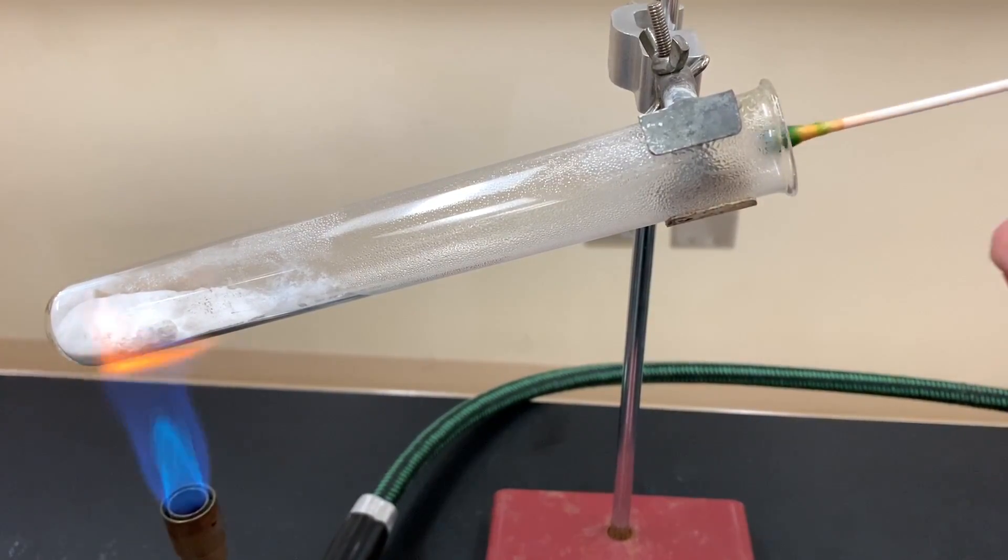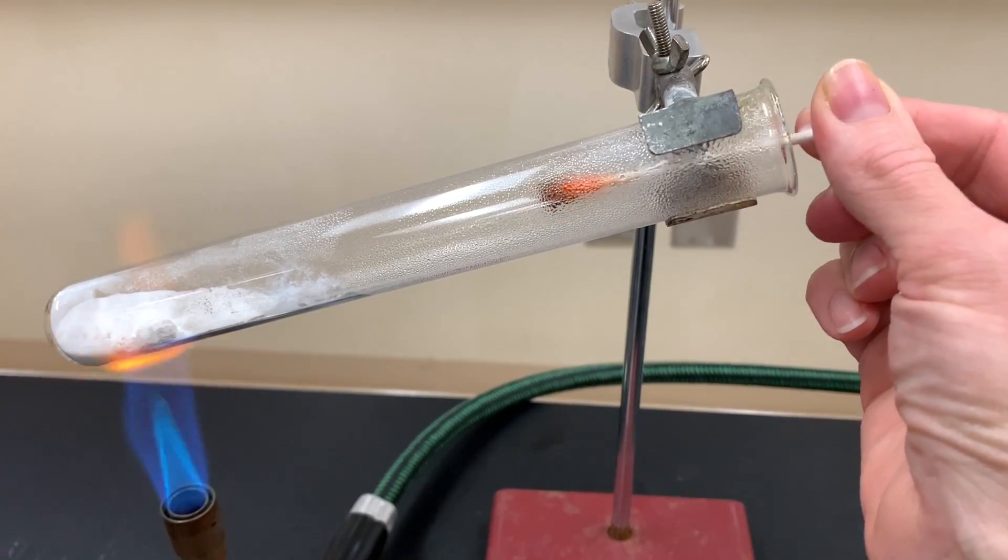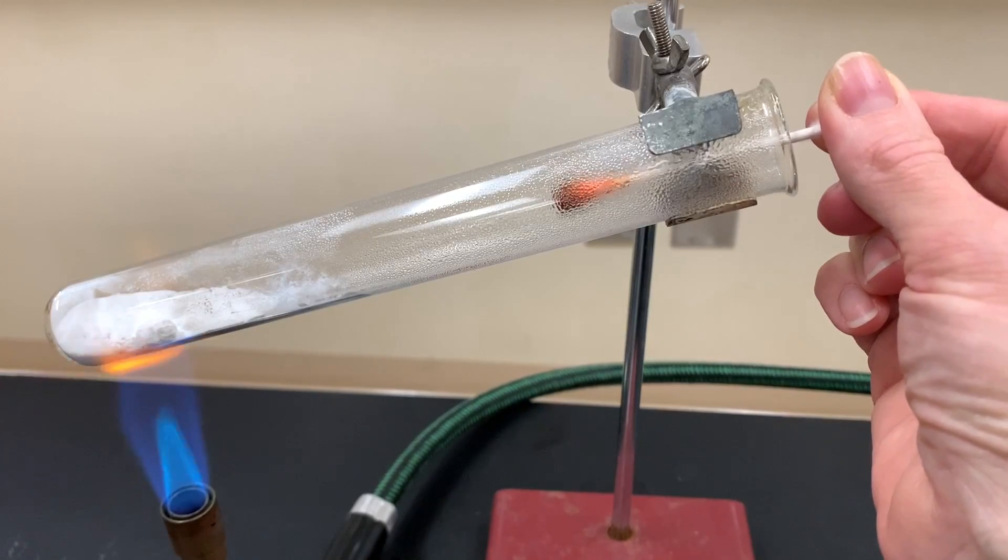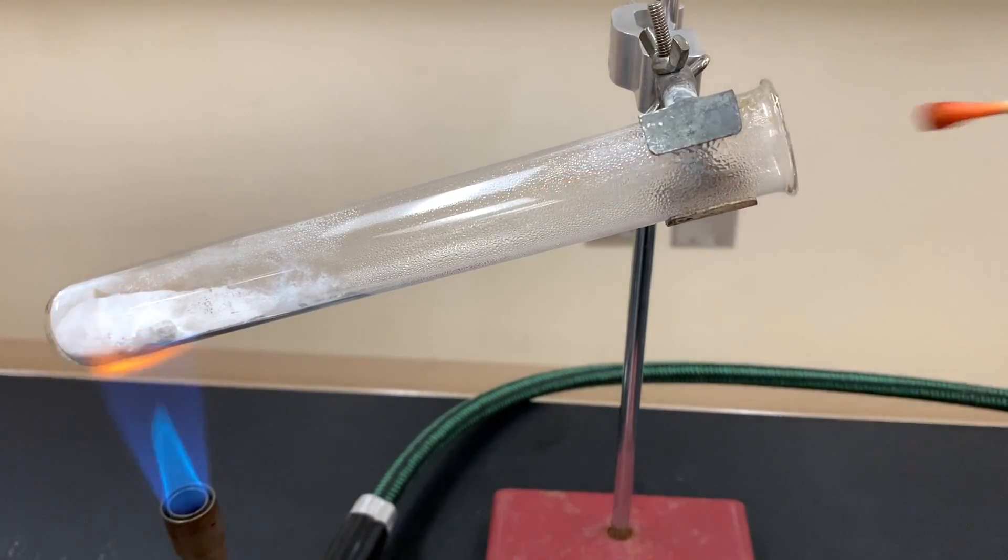I want to put that into the test tube and hopefully look for signs of change. I'm trying to keep my hand away from the heat also for safety sake and again that definitely looks like I'm getting a color change towards the pH of 5.